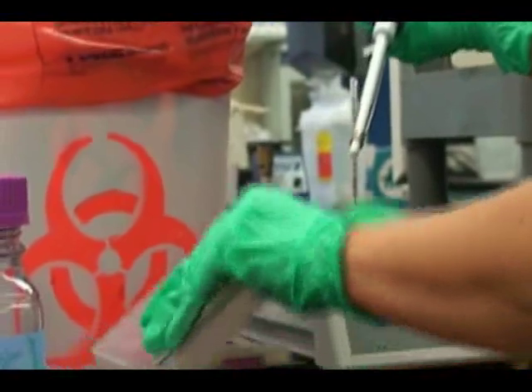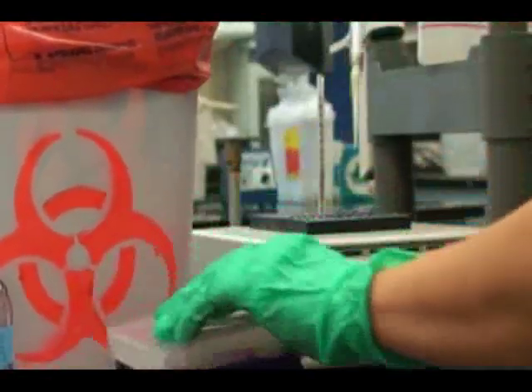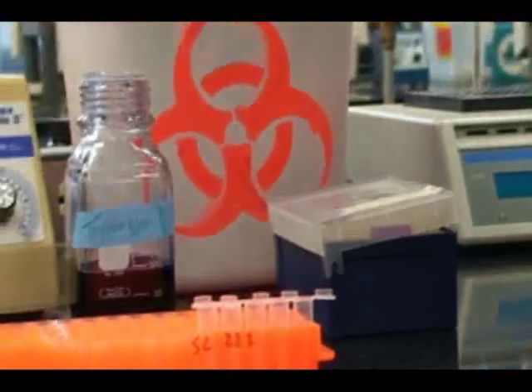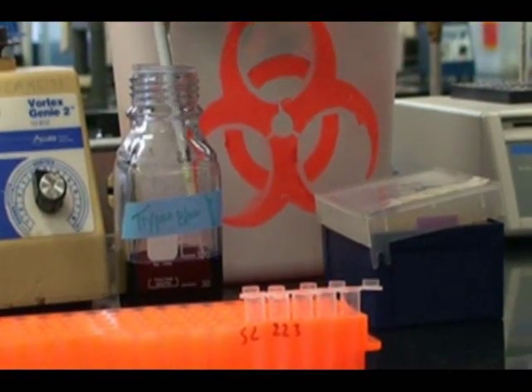Then pipette 100 microliters from your stock to the first 1.5 milliliter tube. In this case, we are using trypan blue as our stock.